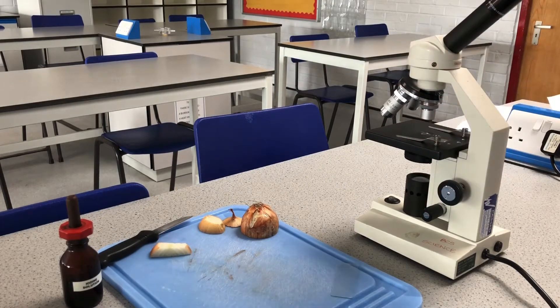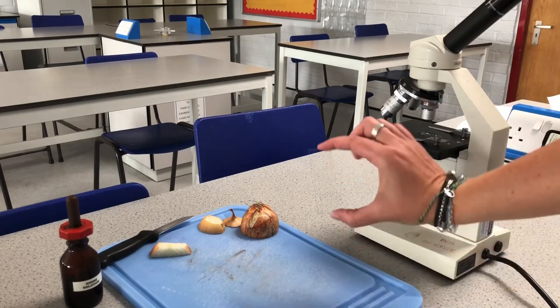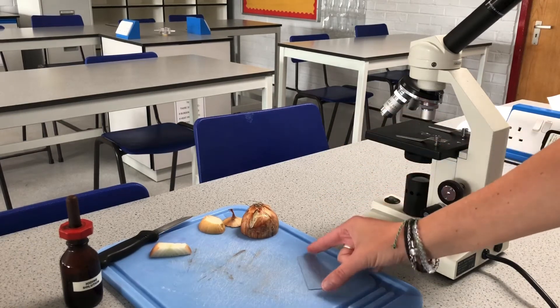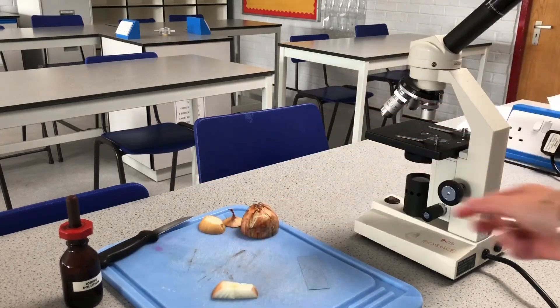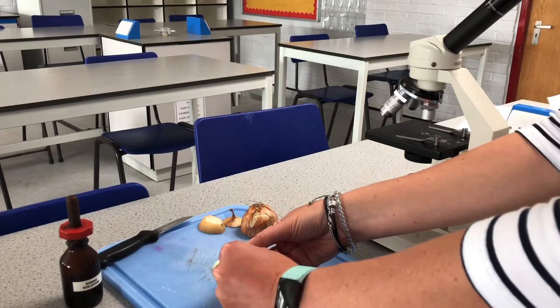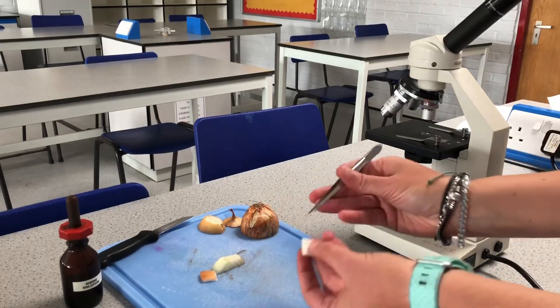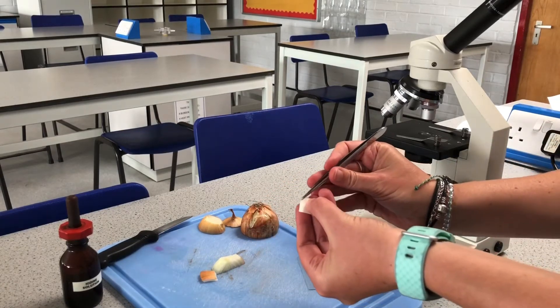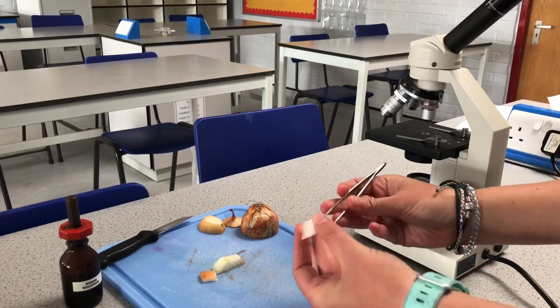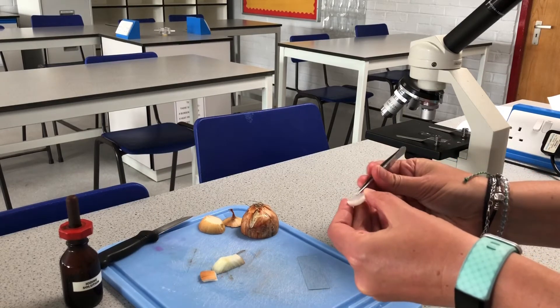I've got a clean microscope slide — you can see how I'm holding it so I don't put any fingerprints on it. I've already cut a section of onion. I'm going to take one of those pieces and, using forceps, peel back that thin layer inside the onion skin.